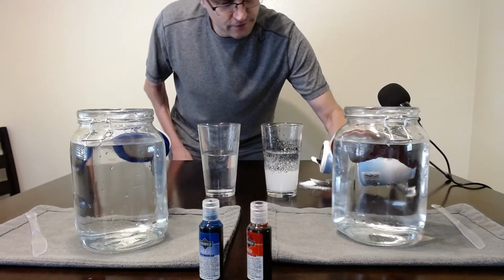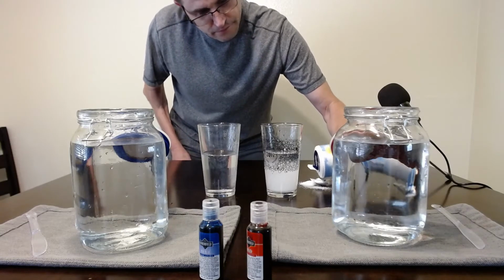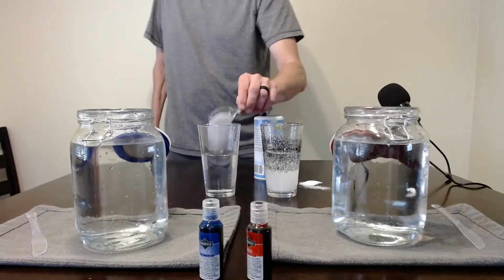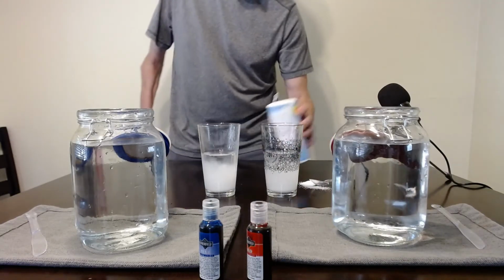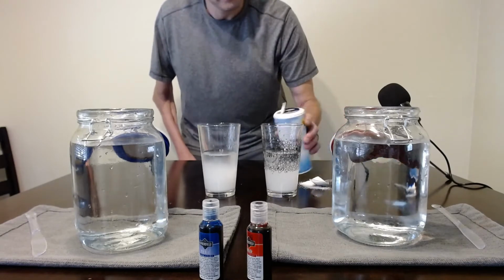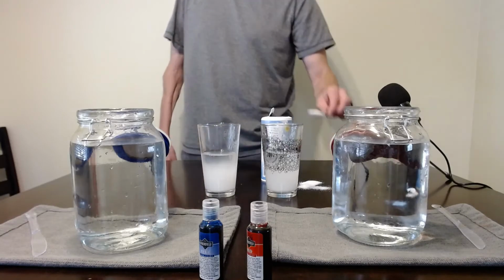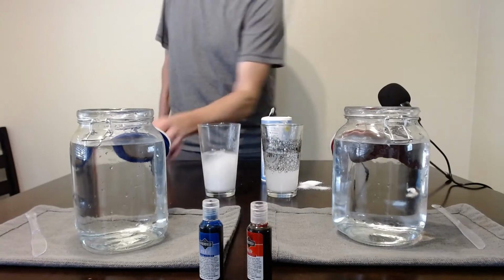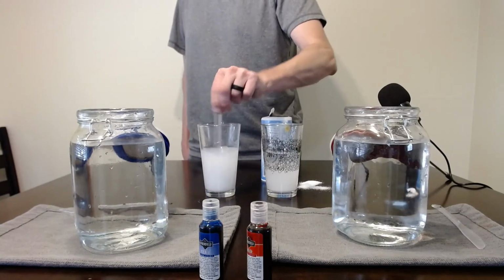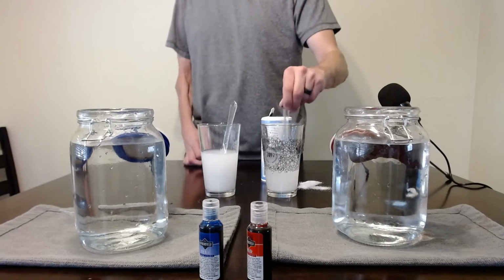And then for the other cup, you want to put a little bit more in. So put 1 in, and then we'll put 1 more. Again, this gets a little messy, but that's okay. Okay, so we'll call this solution A on my left.